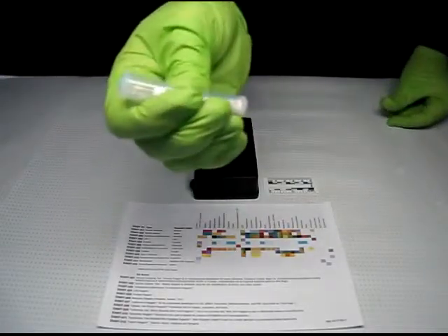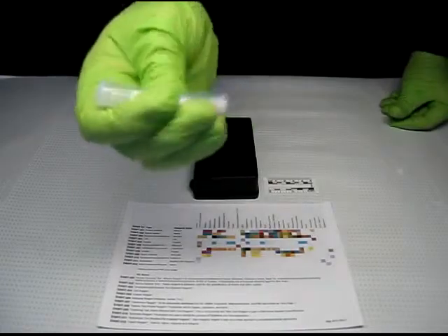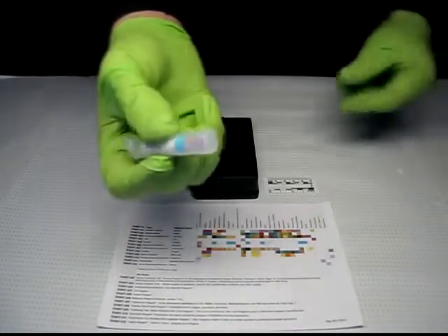Look for a color change from purple on the sampler tip. Consult with the color chart. In this case, the blue color indicates a positive for cocaine.